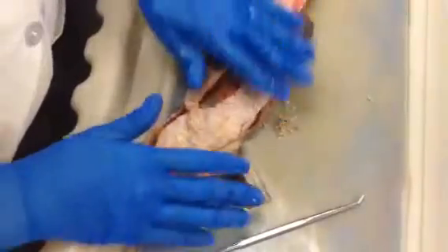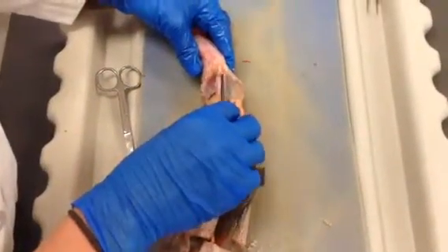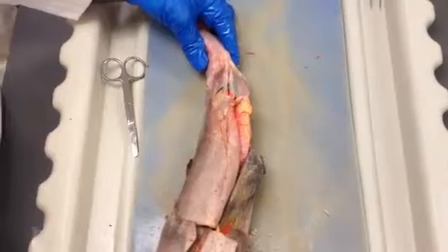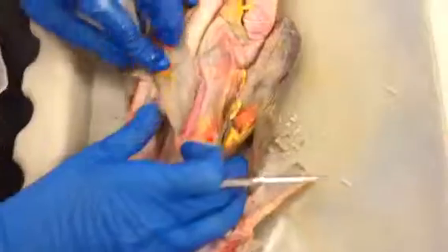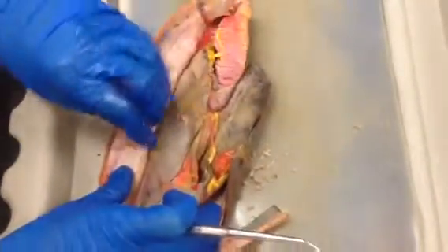Alright. So, this is our shark. First we look down here at the pelvic fins and notice that we have claspers, so we know that it's a male. That's important for when we're looking at the testes to determine if it's a testes or ovary for male or female. Right, we open up the oral cavity here where the mouth is and the gills, and then we opened up the pleuroperitoneal cavity where the organs are.